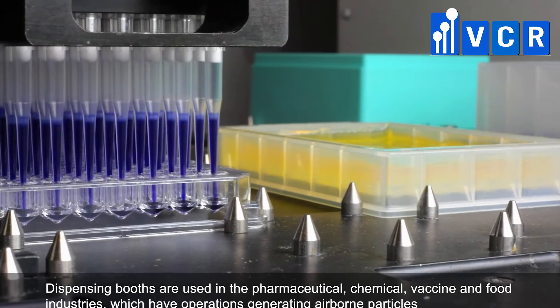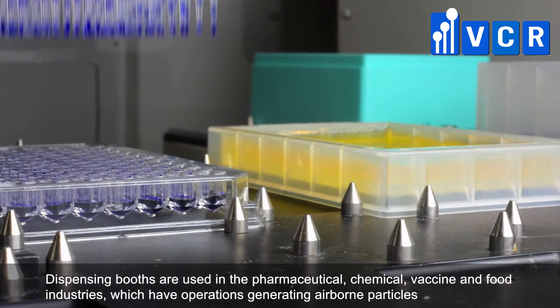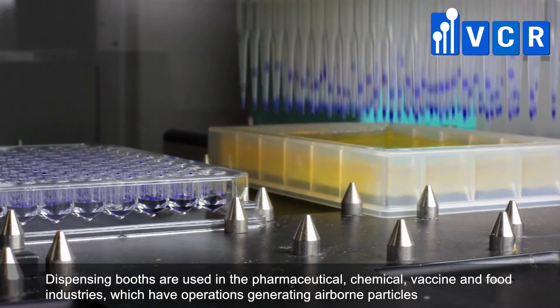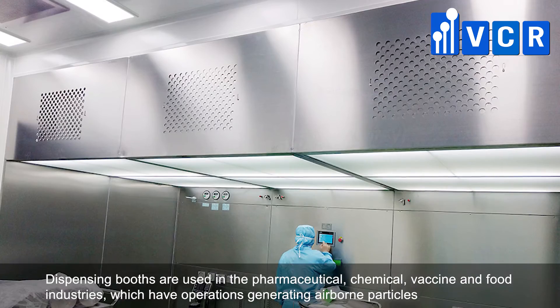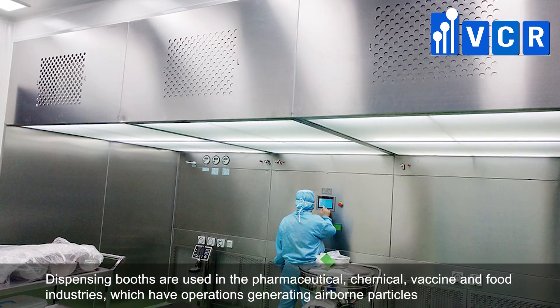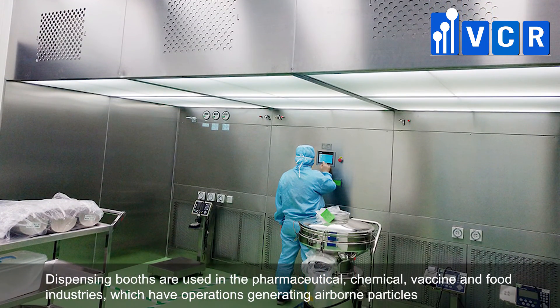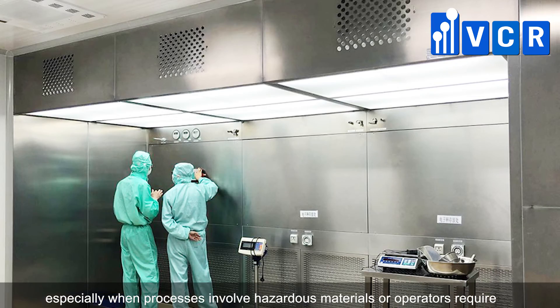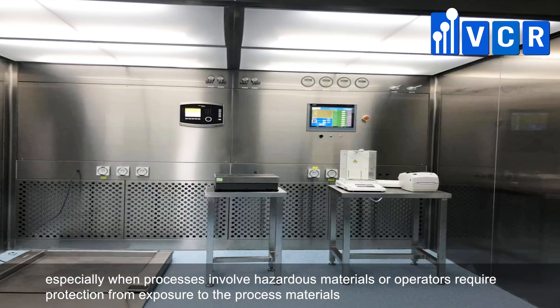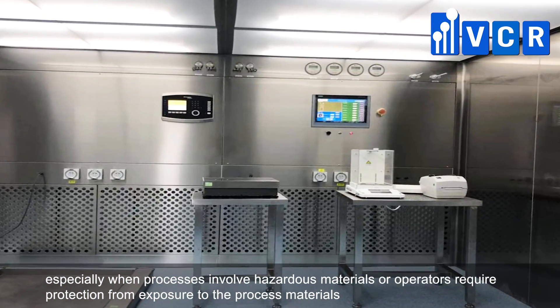Dispensing booths are used in the pharmaceutical, chemical, vaccine, and food industries, which have operations such as weighing, grinding, dispensing, and filling that generate airborne particles — especially when processes involve hazardous materials or operators require protection from exposure to the process materials.